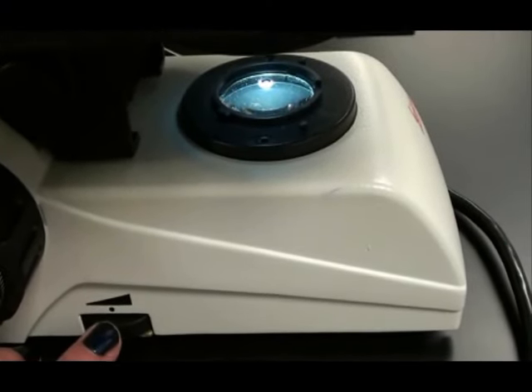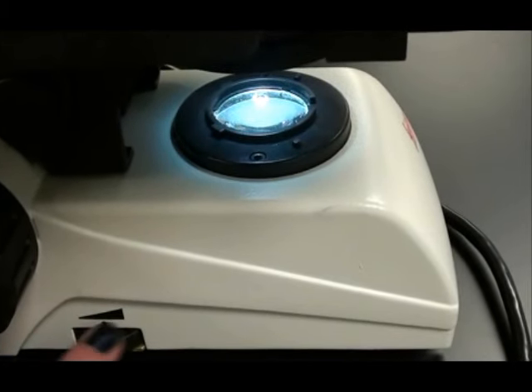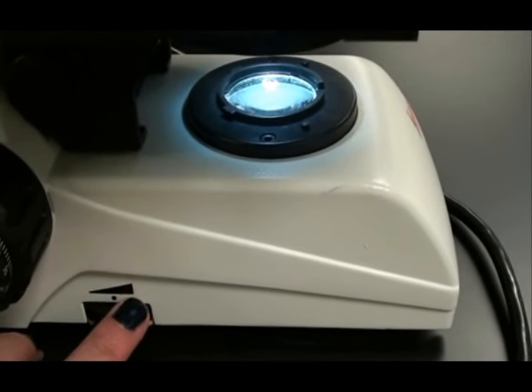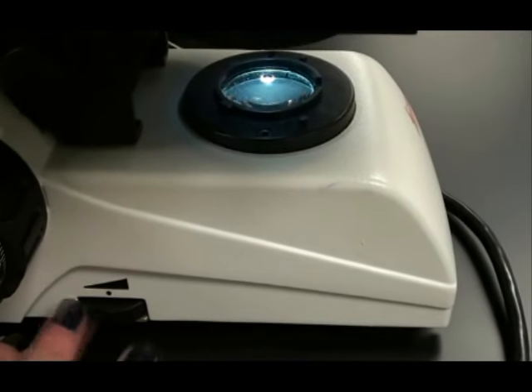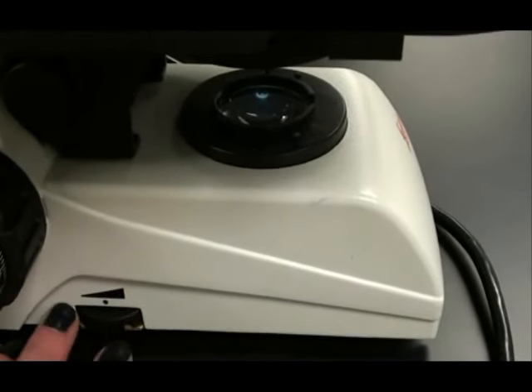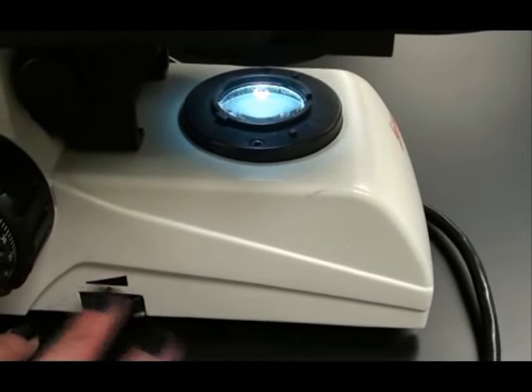Understanding how to adjust the amount of light that's shining through your specimen is an extremely important skill to have. Too much light and your specimen can be washed out. Too little light and there's not enough illumination to see it. Adjusting the light allows you to manipulate contrast—that's the difference in the visibility of your specimen versus the background.